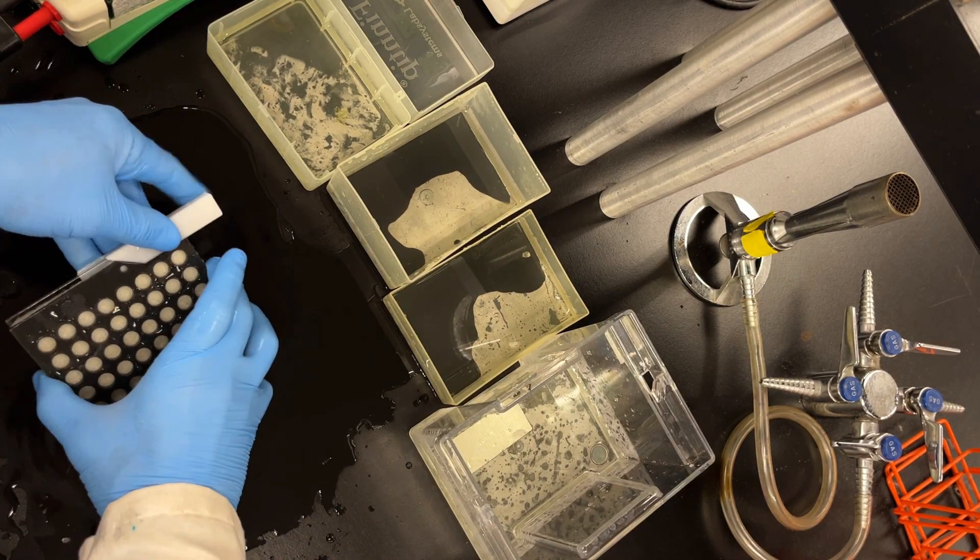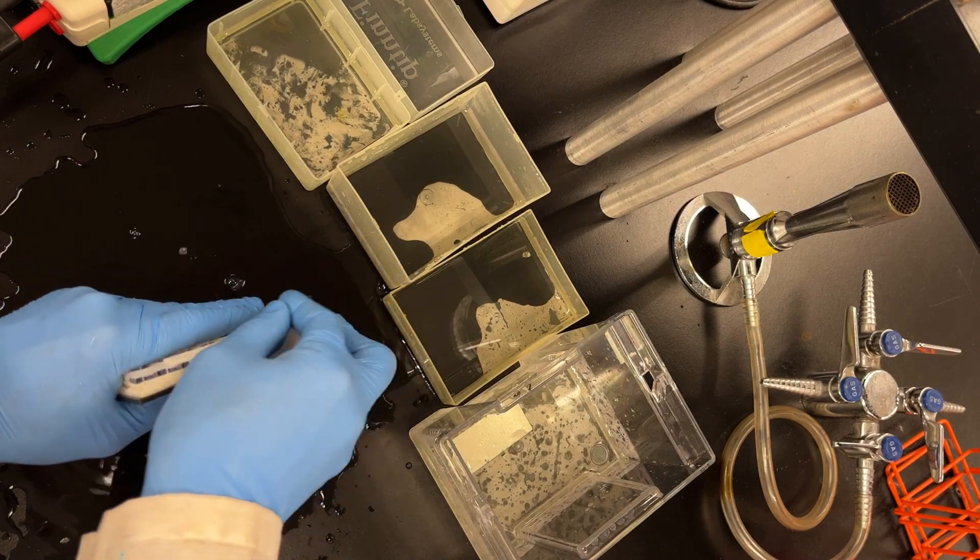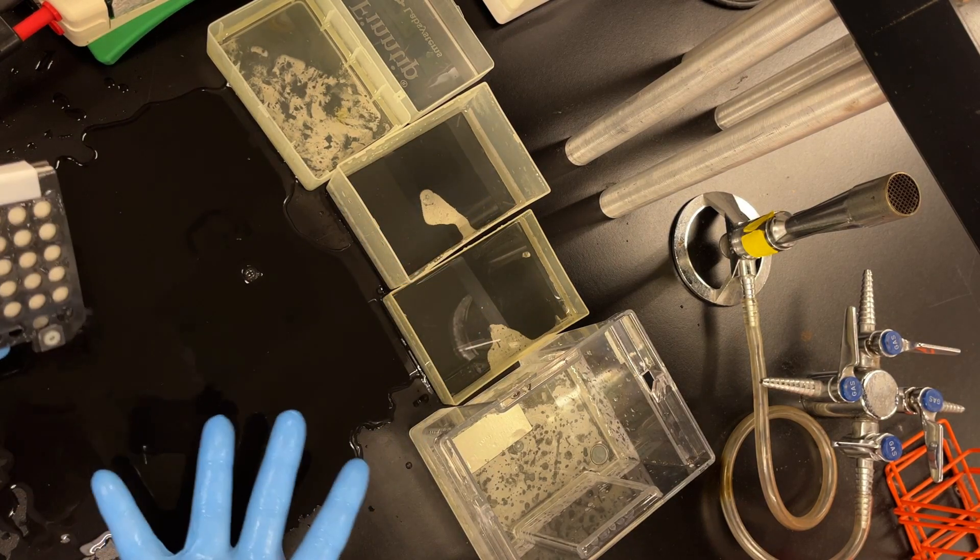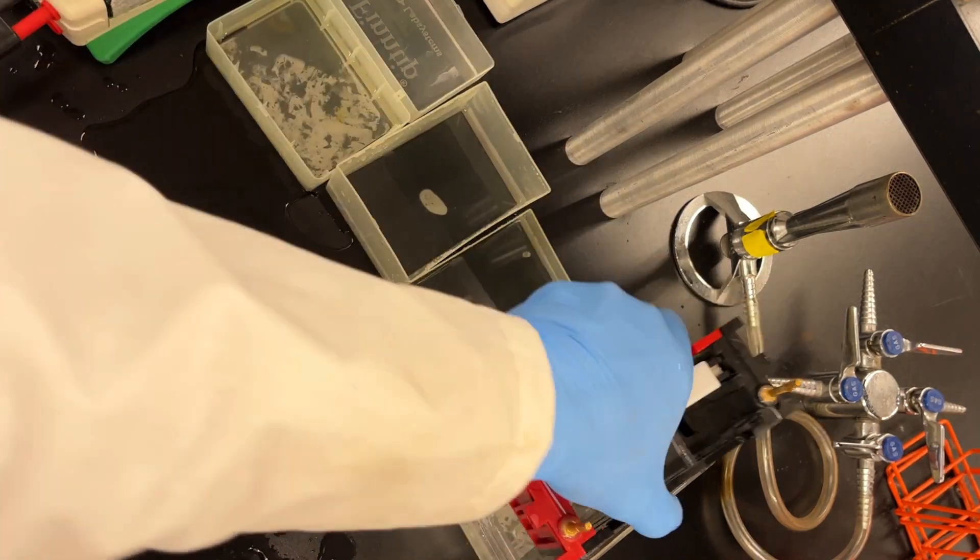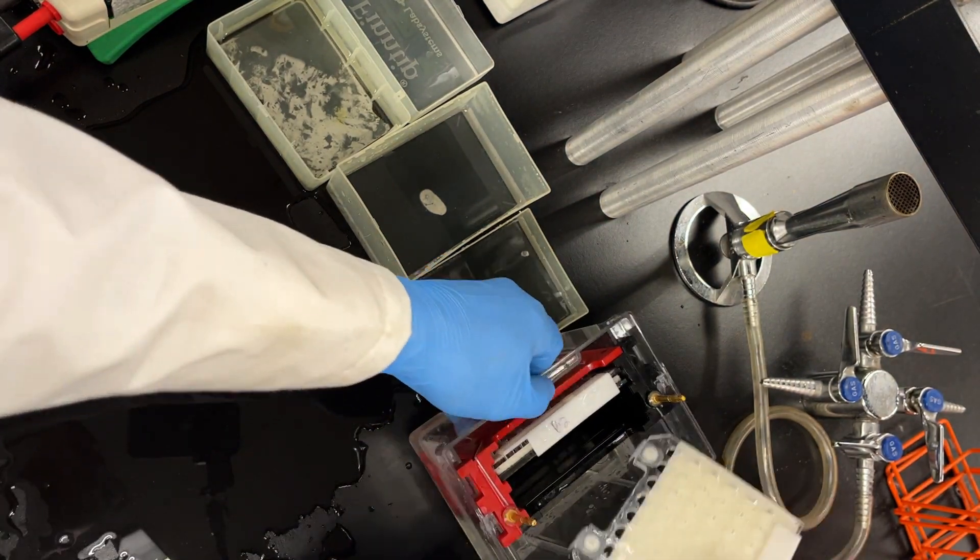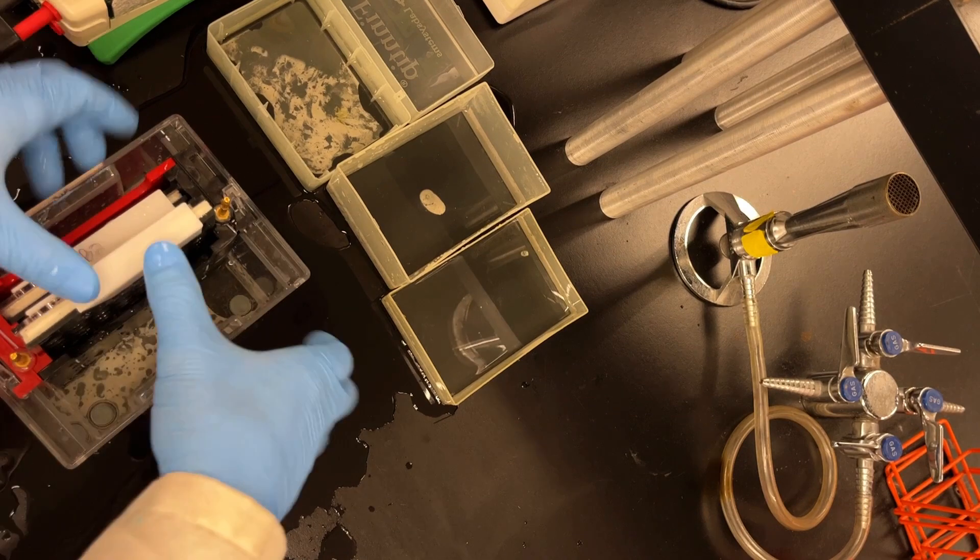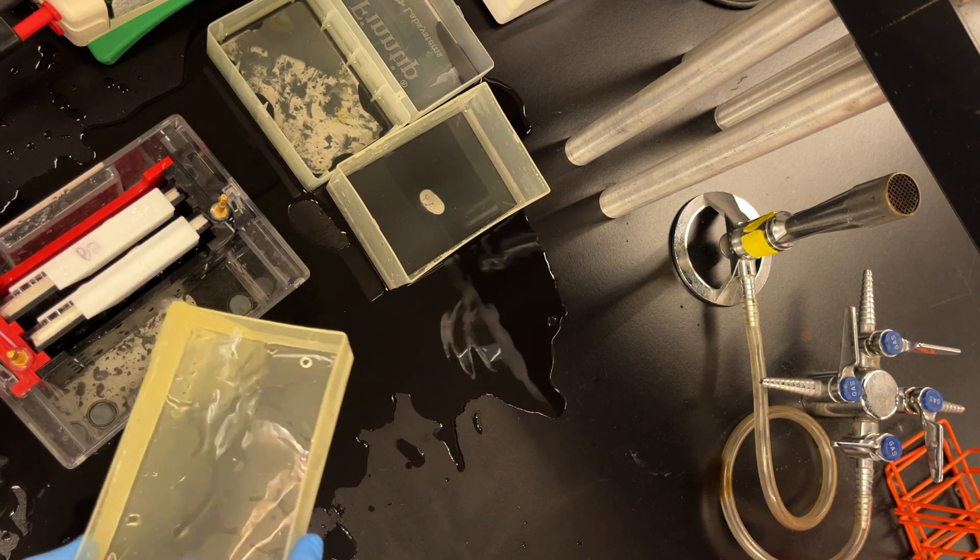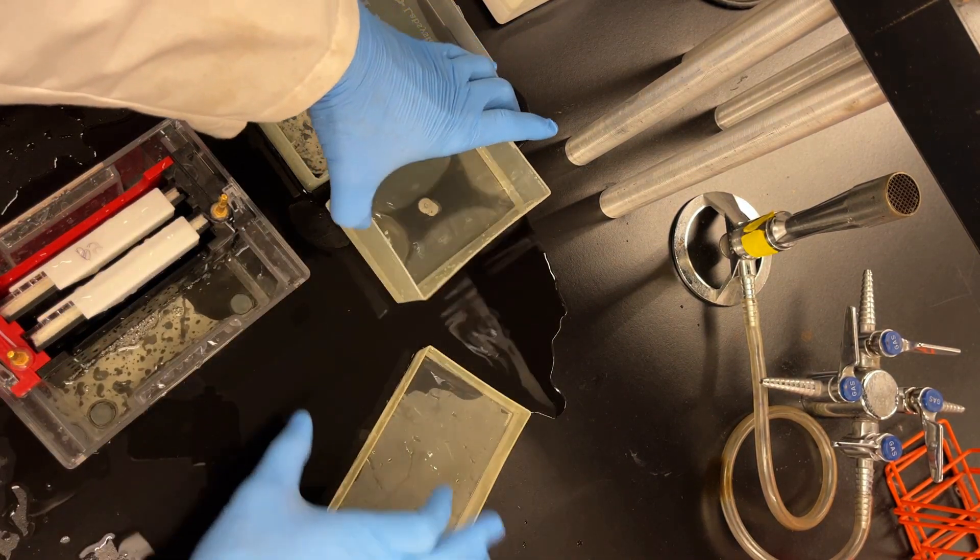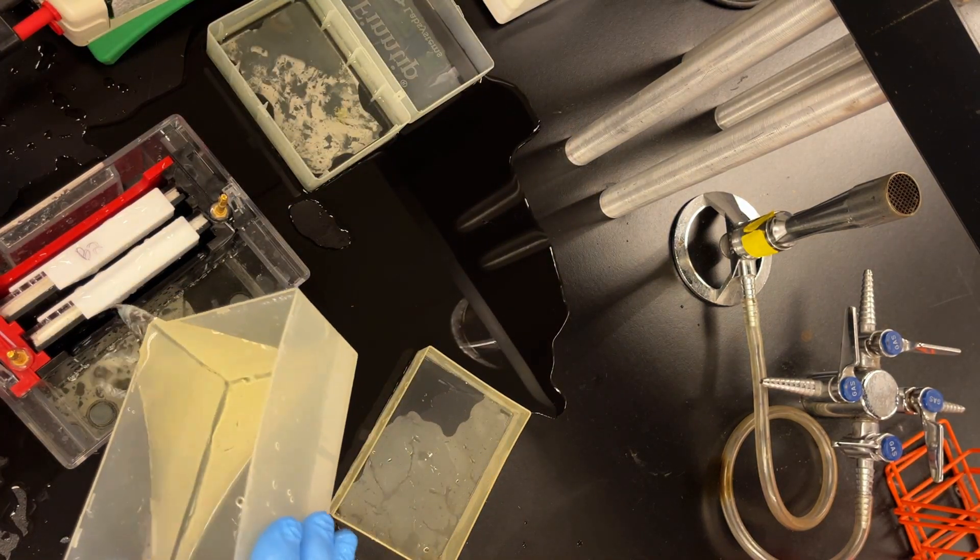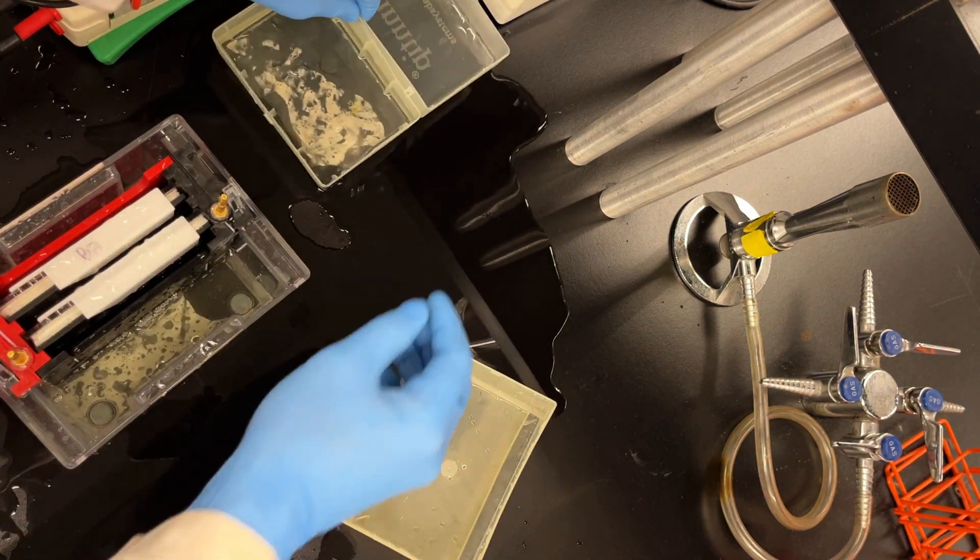Now like I said, I left kind of a mess. I was able to do it fast enough where it just didn't quite start dripping on the floor, but it was close. So using some sort of container would have been much better. And then everything goes into a gel tank. And then you can use up all this transfer buffer. So I just chuck all the transfer buffer in there. And then I'm going to get ready for transfer after I clean up my mess.